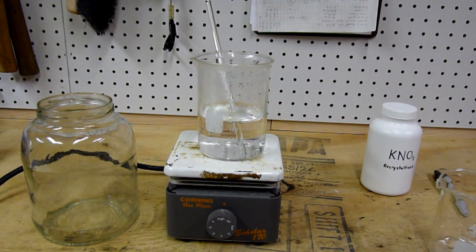Hey everybody, it's me again with another Doug's Lab video. Today I'll be demonstrating how to purify potassium nitrate through recrystallization.